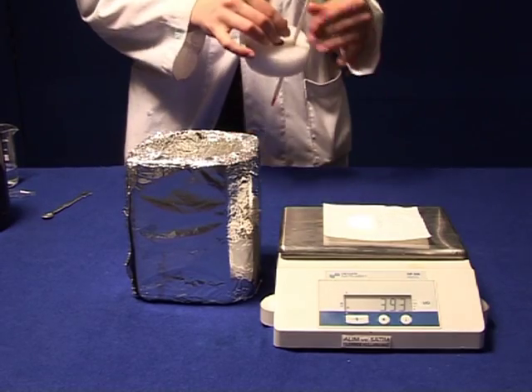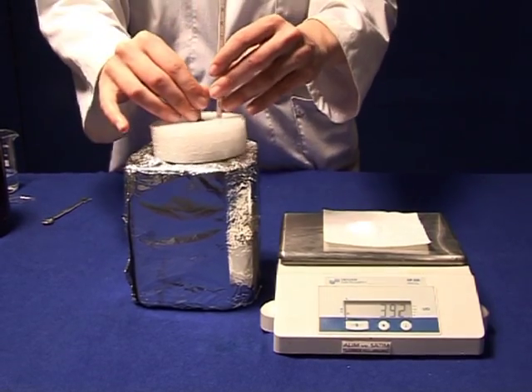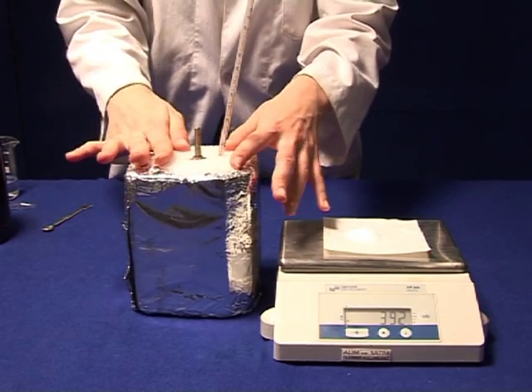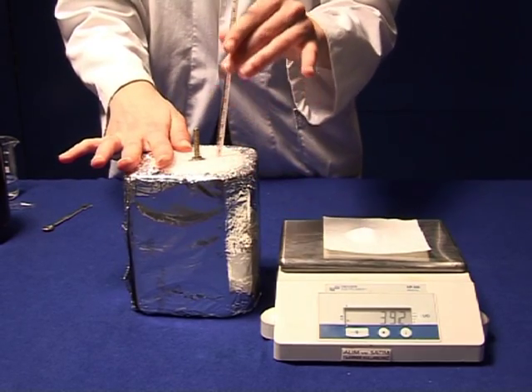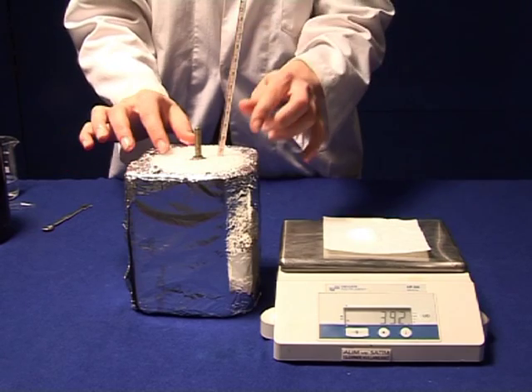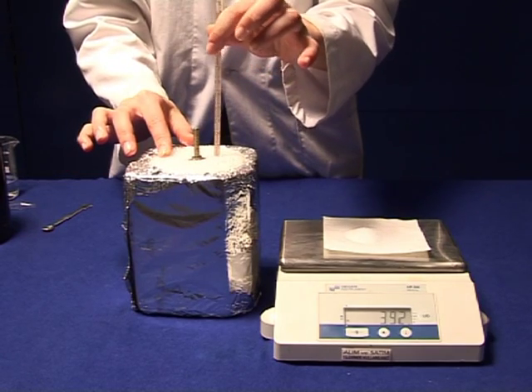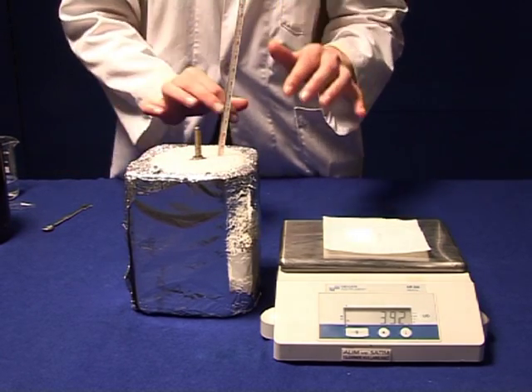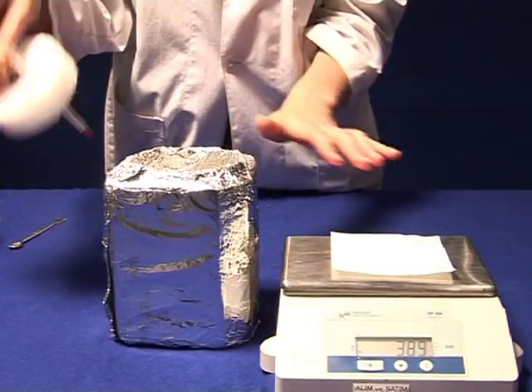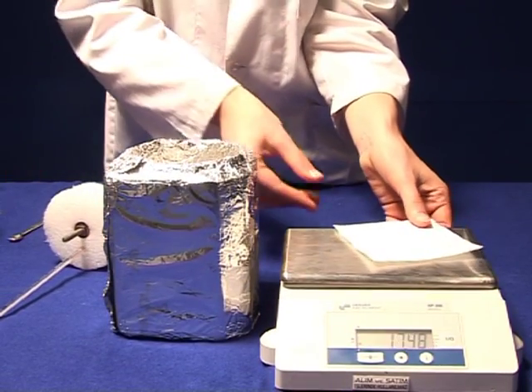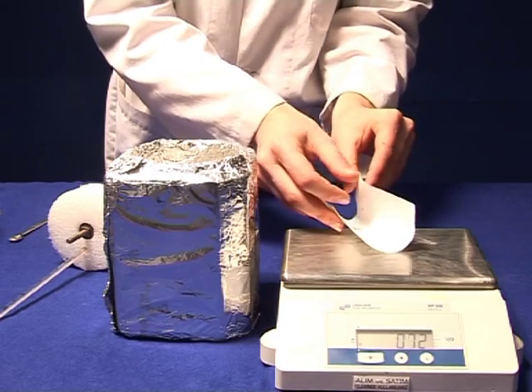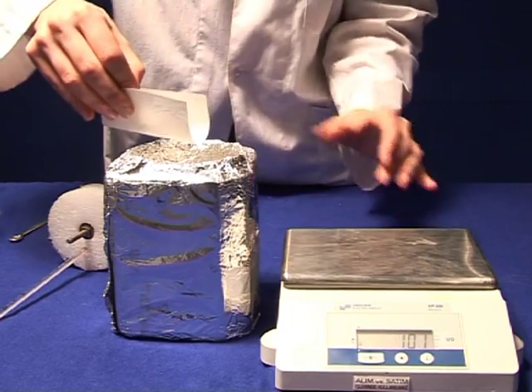Place a volume of distilled water equal to the final volume of solution from the first part in an insulated cup and collect temperature-time data at 30 second intervals for 5 minutes. Then add the weighed amount of salt and swirl to dissolve.